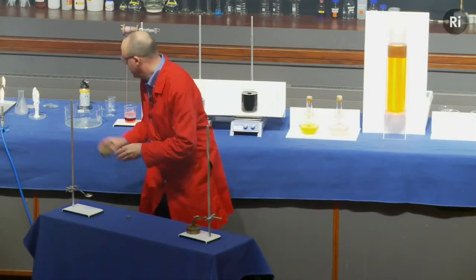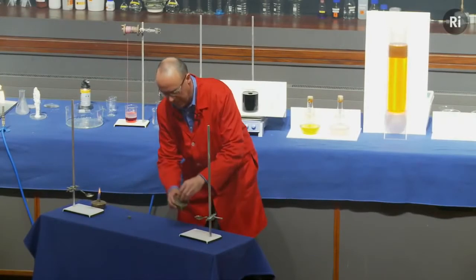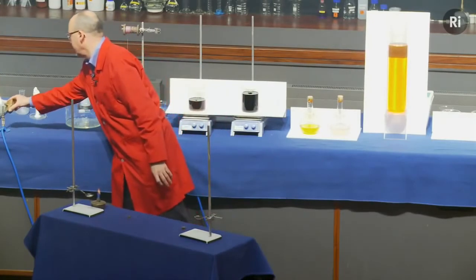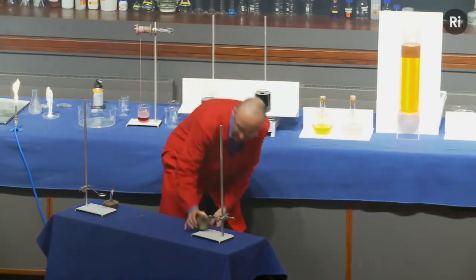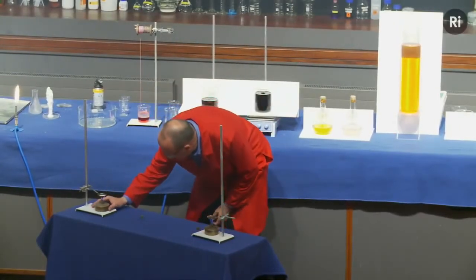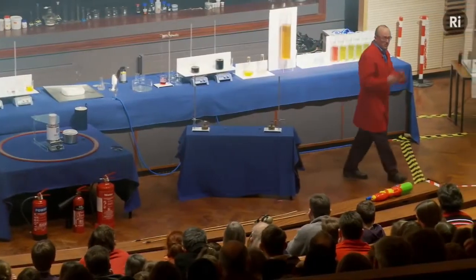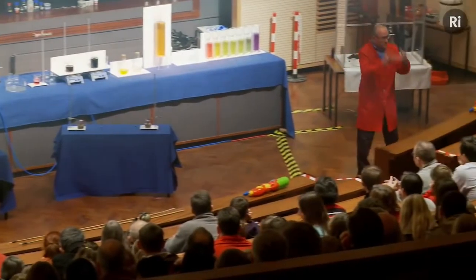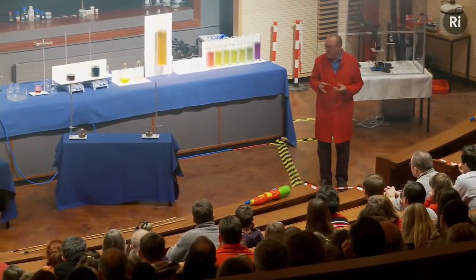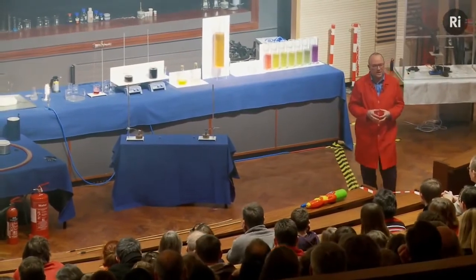Now, what we're going to do is to heat up these 2 spoons, and we'll see if there's a difference between these 2 powders. So there's the gunpowder, and this is the yellow powder. Now, gunpowder, when it burns in the open, doesn't make a bang. It just burns with a puff and a little cloud of smoke. So we're not expecting the gunpowder to make a bang. The yellow powder, however, very probably will make a bang, and it could be fairly loud.